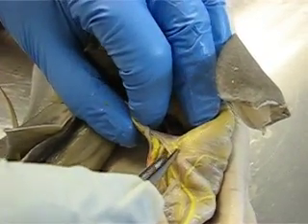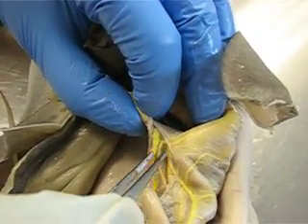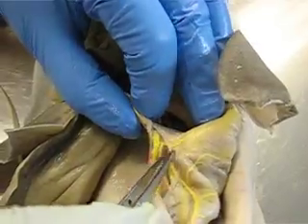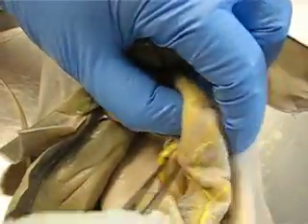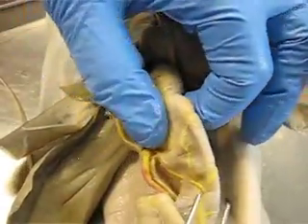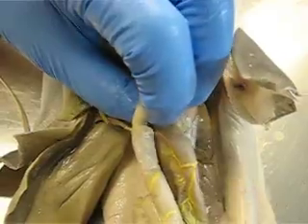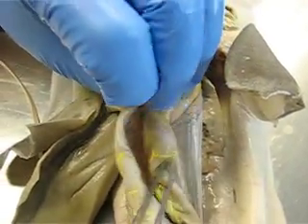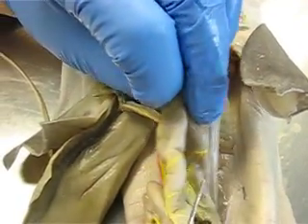Then we go towards the stomach — we have the dorsal and the ventral. The ventral runs this way, and the dorsal goes around back. That's the dorsal gastric artery. The one goes around the back, and you're going to see it on this side.